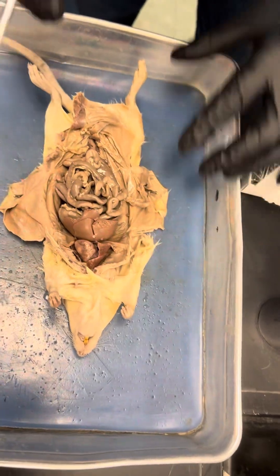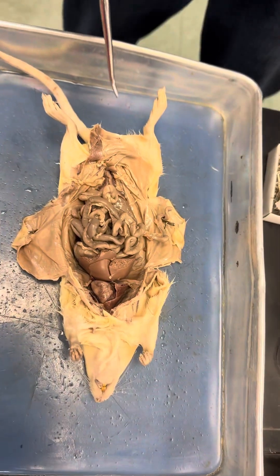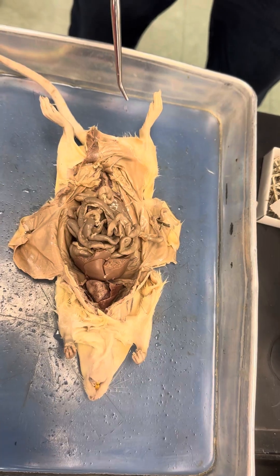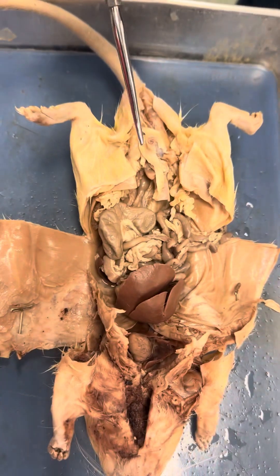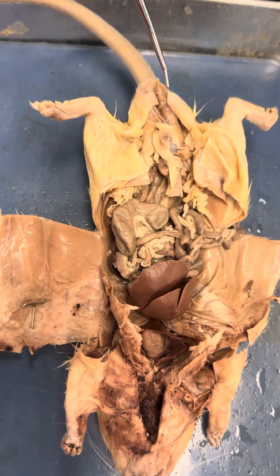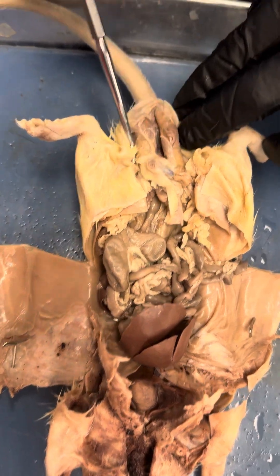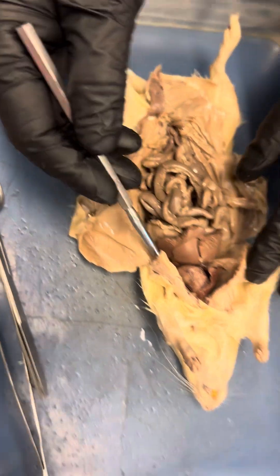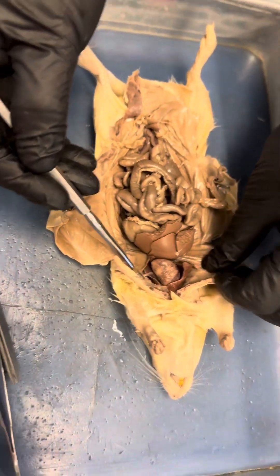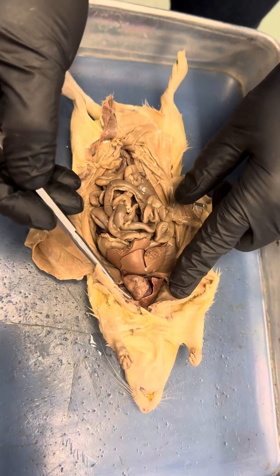This one is a female rat and this one is a male rat. How are we going to find out? The male has testes. Females don't have testes. So let's talk about the female first.